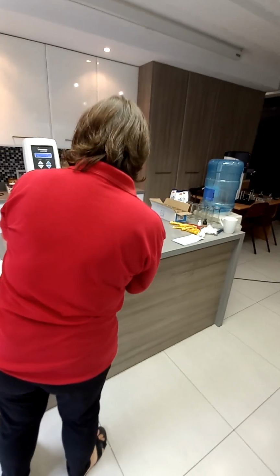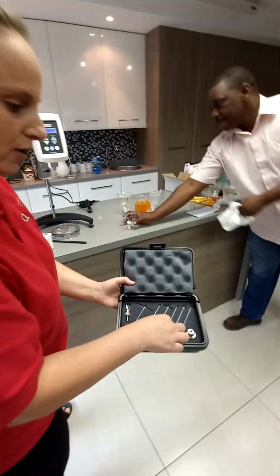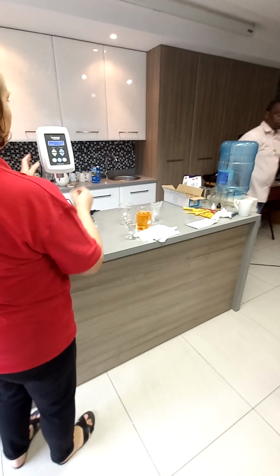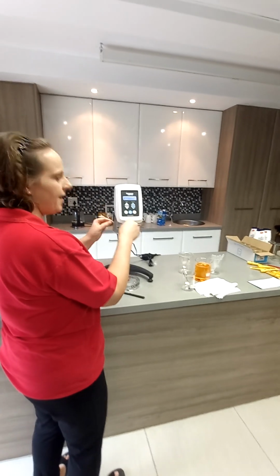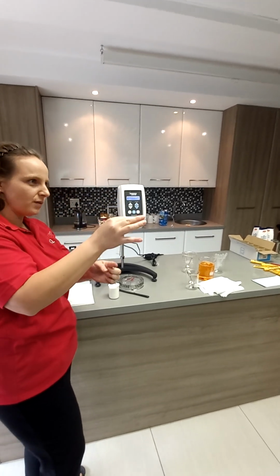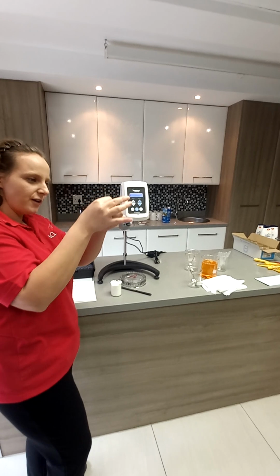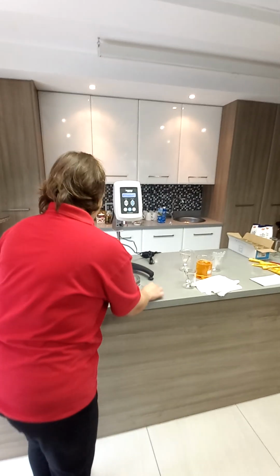Okay, so you'll see this stand is a motor. And then you've got these thin, what we call T-bar spindles. See how thin and delicate. So the motor would move the viscometer head down and up slowly. And while that action happens, the spindle would rotate. So you would rotate and go down into your sample. You're going to hit new sample as you go down, so it won't be at one point where you can make a hole. So this is what you would use for your non-flowing.